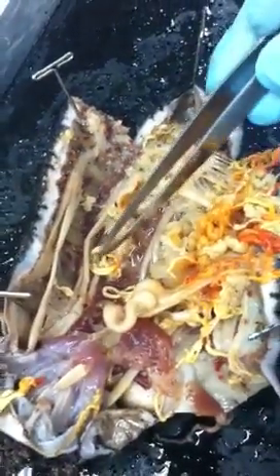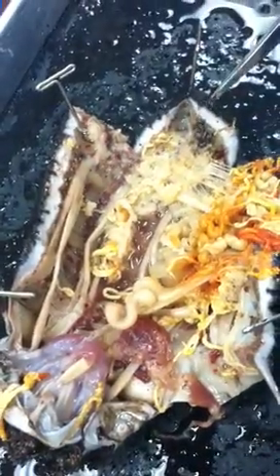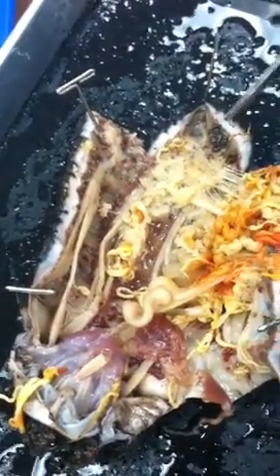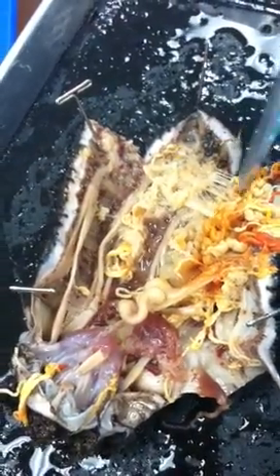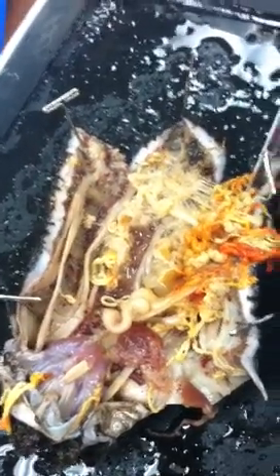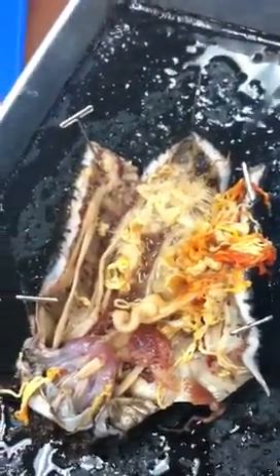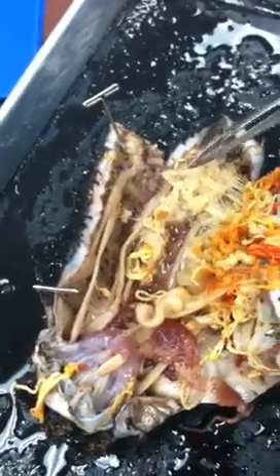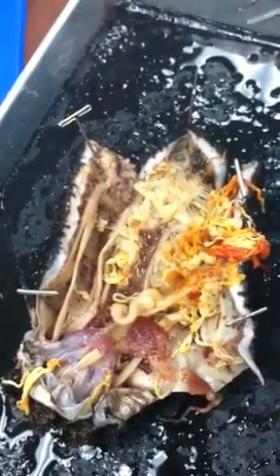Wait, where's the tree here? So right here. There's some pieces of gonads mixed in with it, but the water comes in and then goes up here for gas exchange and then comes back out. Where's the respiratory tree? So this right here. Okay. And whatever is down there at the bottom. Okay. What did you say about gas exchange? It happens in the respiratory tree. See, the cloaca pushes it up through the respiratory tree, then it goes right back out. Like we breathe in air, they breathe in water through the cloaca and then do the gas exchange and then just expel the used water. Makes sense.